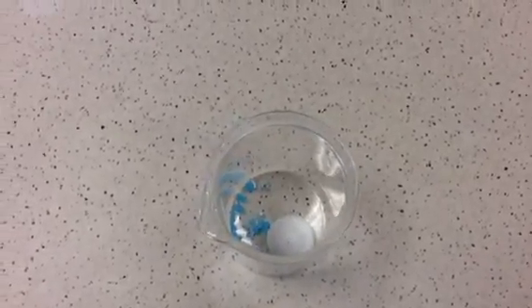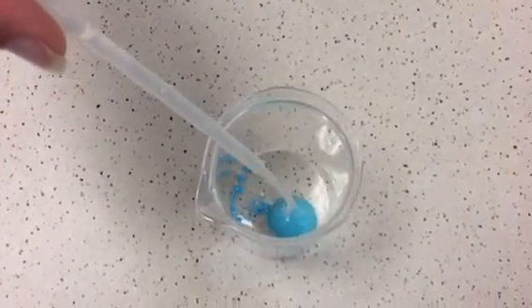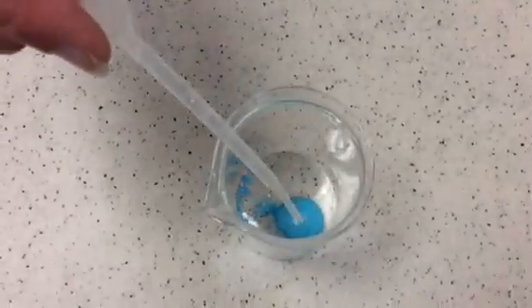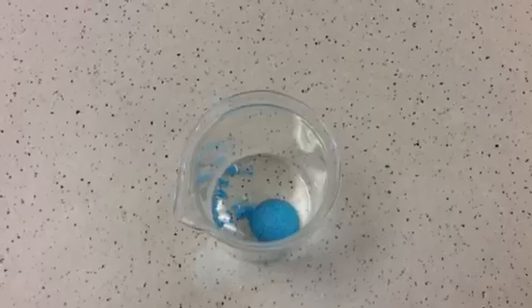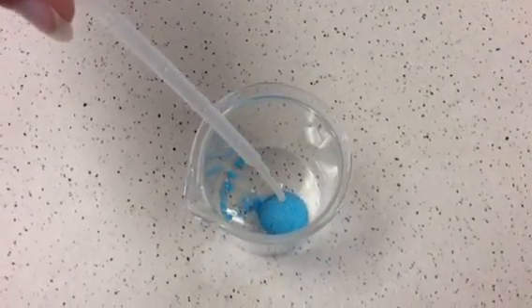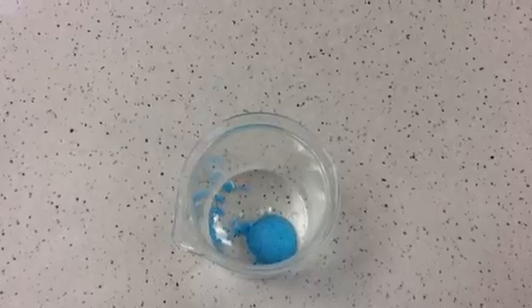So if we add some water to our anhydrous copper sulfate, let's see what happens to our copper sulfate in our beaker. Okay, and as we add the water, it steams a little bit. So because it's steaming, giving off energy, think about what type of reaction that must be if it's giving off energy. So heat's coming out of it. Does that mean it's exo or endothermic?